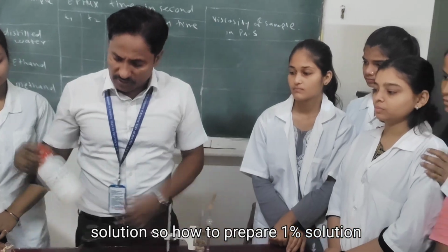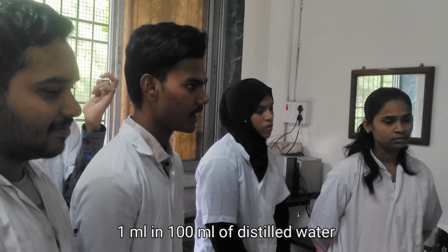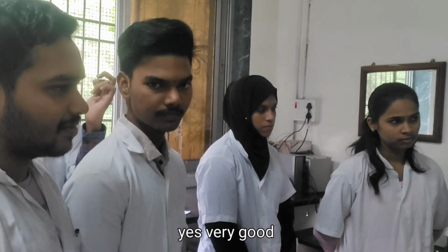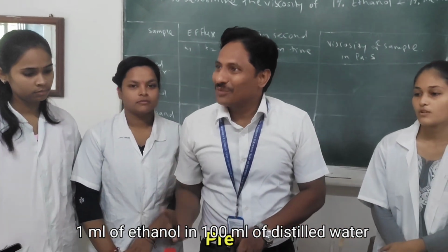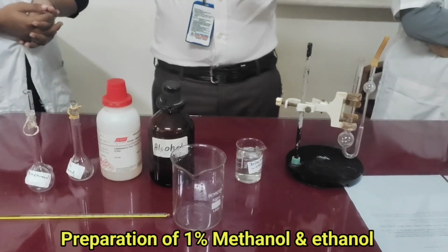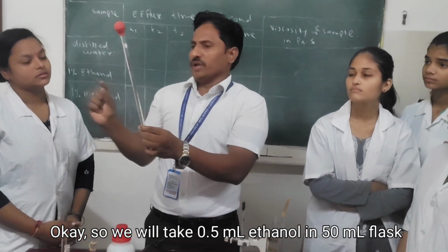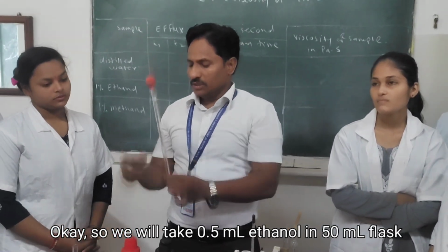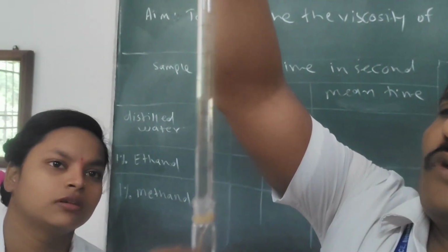So how to prepare a 1% solution of ethanol? Tell me. Very good. 1 ml in 100 ml of distilled water. Absolutely right. 1 ml of ethanol in 100 ml of distilled water, that is 1% volume by volume. Okay, so we will take 0.5 ml of alcohol in 50 ml.